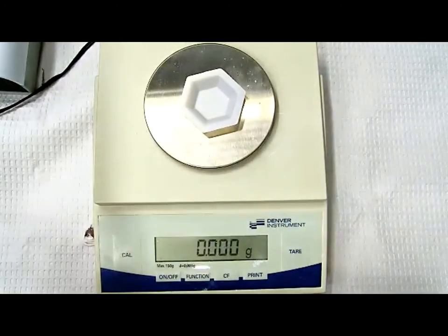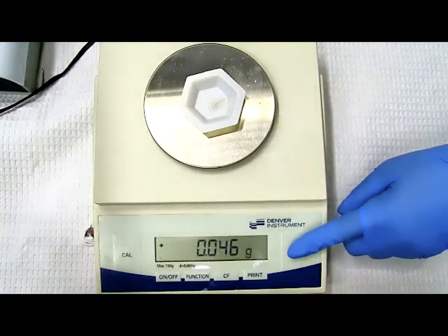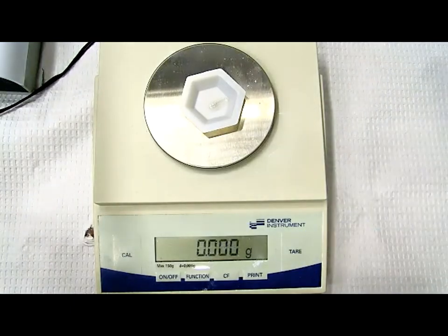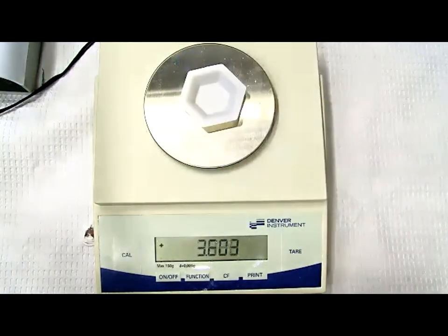I do not want the weight of the capsule shell. So before I punch, I need to place the capsule shell in the weigh boat. It will give me some weight, in this case, 45-ish. I do not want this weight, so I want to tare that. So therefore, now I'm ready to do punch.